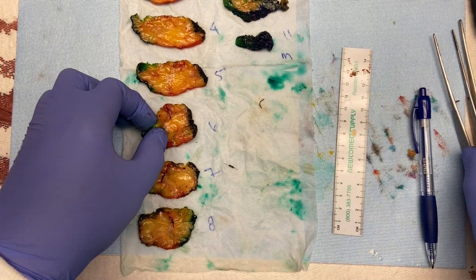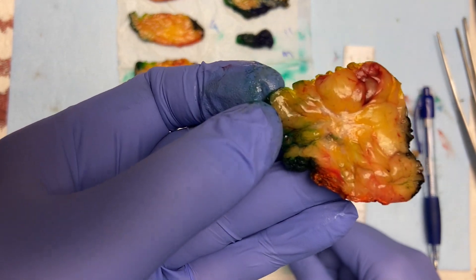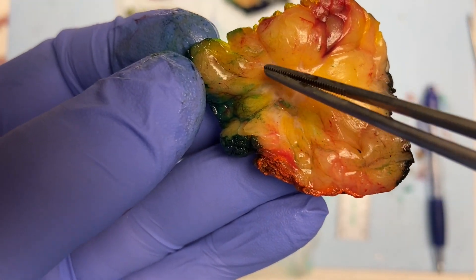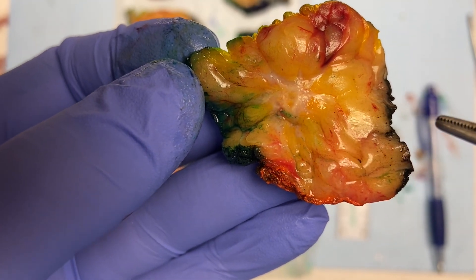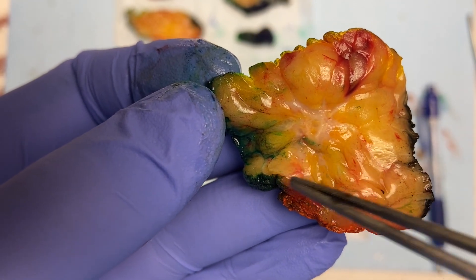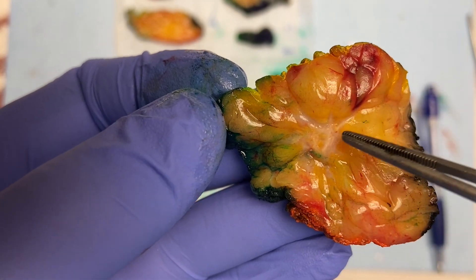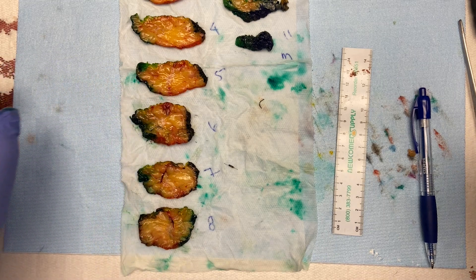I wanted to show you the breast tumor — this is an invasive ductal carcinoma, intermediate grade. You can see it is very stellate-looking. We have all of our margins visible. I'm about to call the size of the mass and how far it is from all the margins.